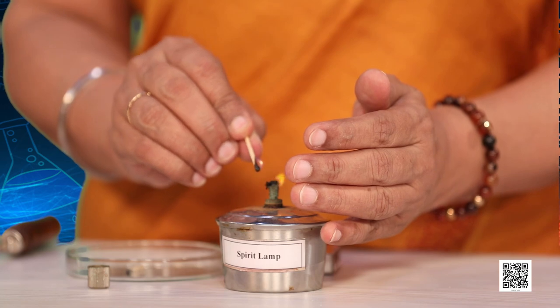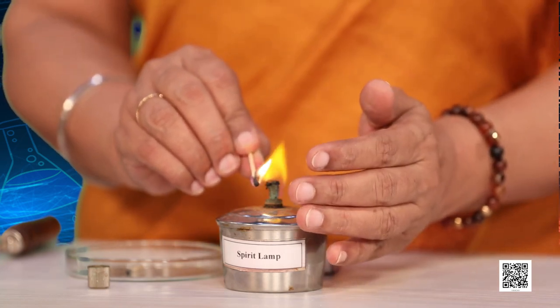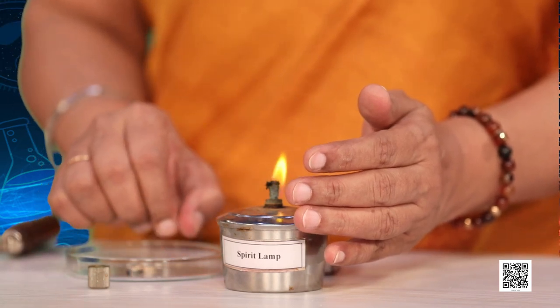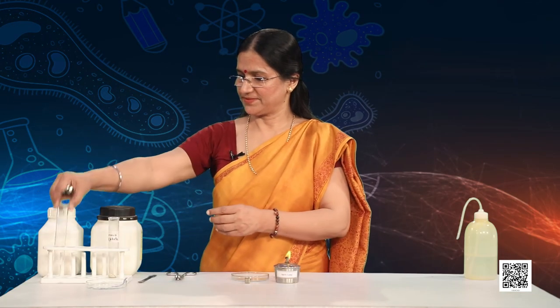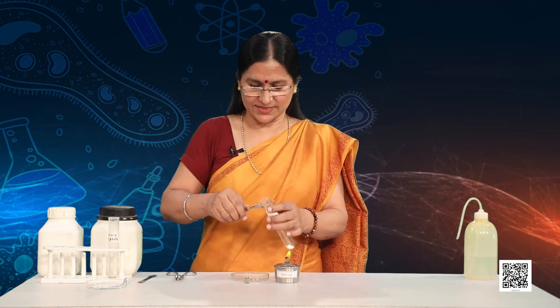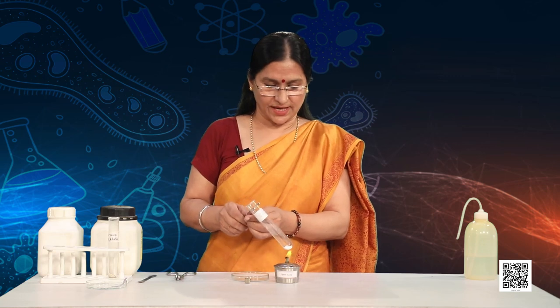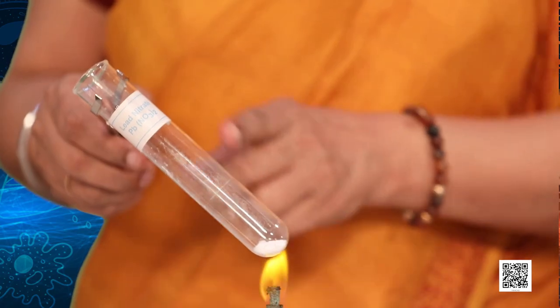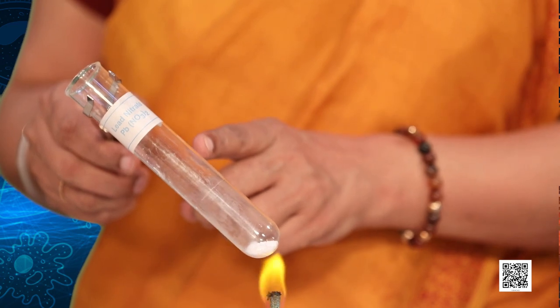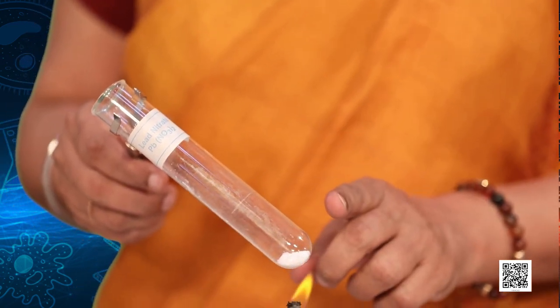Never do this experiment on your own — always do it under the assistance and guidance of a teacher. I am holding this tightly with a test tube holder and heating it, keeping it at an angle of 45 degrees. Note the colour of the lead nitrate, because slowly there is going to be a change.